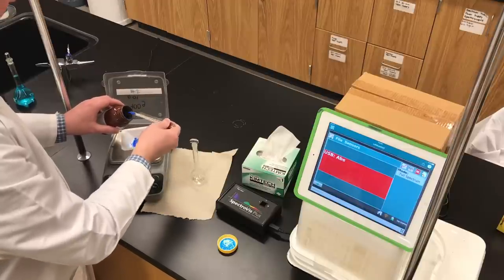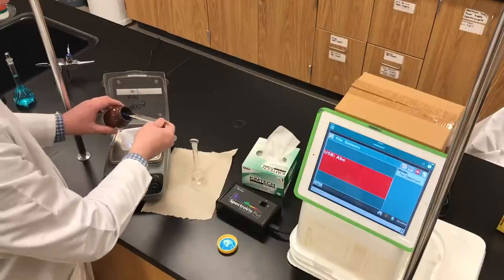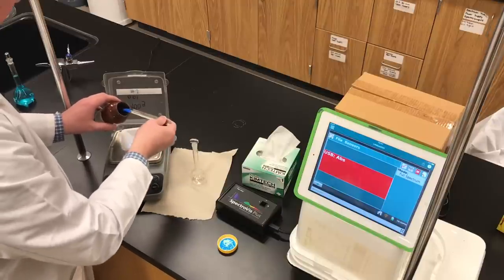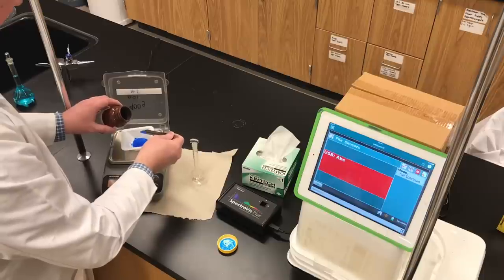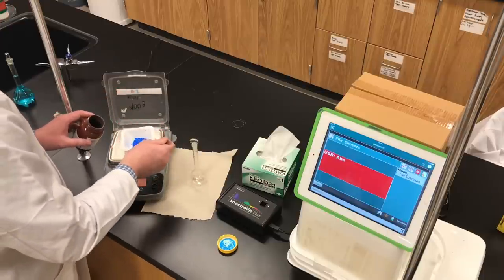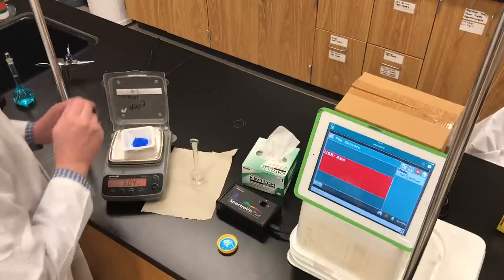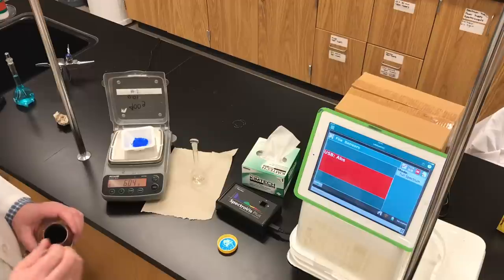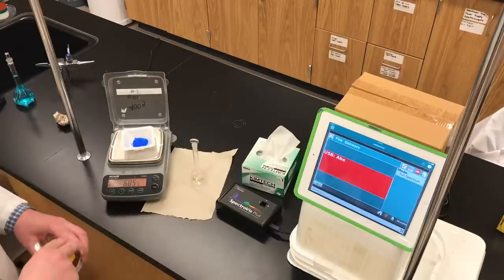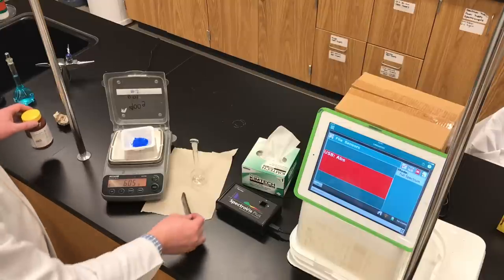I have a preconceived mass of copper nitrate that I'd like to weigh out. I'll get it close to the mass I want, slow down a little bit, and remove a tiny bit if I've added too much. Record the mass of the copper-2-nitrate trihydrate that we're using.